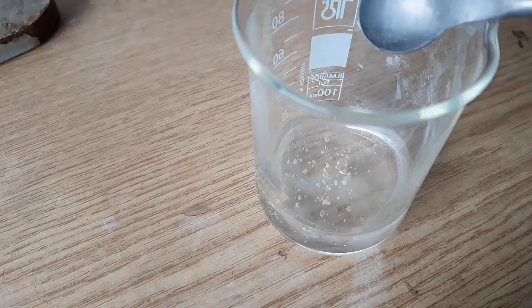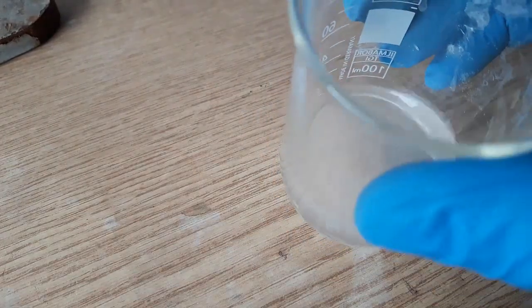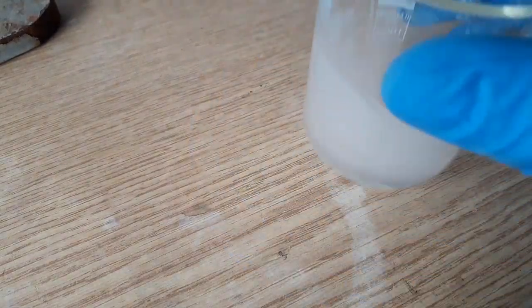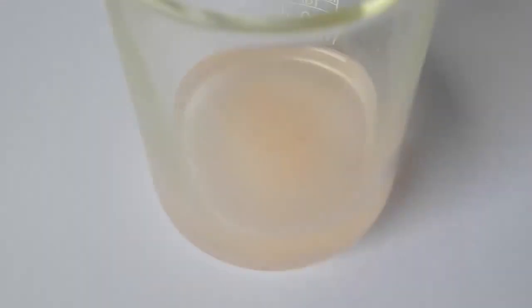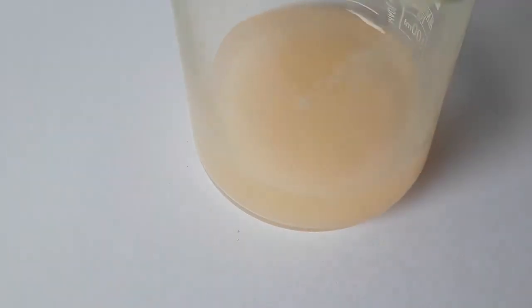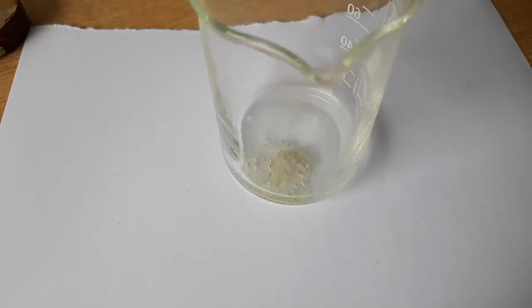Another paper stated that it is insoluble in water, but after adding a bit to some water, not only did it dissolve, it actually made a pinkish peach solution. What about acetone? Well, it acted similarly to ethanol but it looked more like a suspension.